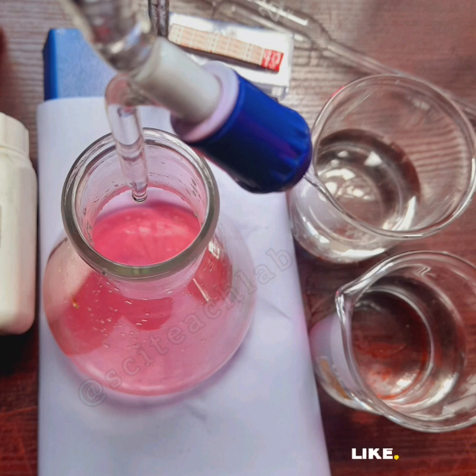If the table is too high, you can bring the burette down to a lower stool, or you climb a stool, so that you will see the level of the liquid inside the burette where you're going to take the reading from. You see it at your eye level without having to look up or look down. That's when you get your readings correctly. Then you do your calculations, and recheck them to be sure you didn't make mistakes.